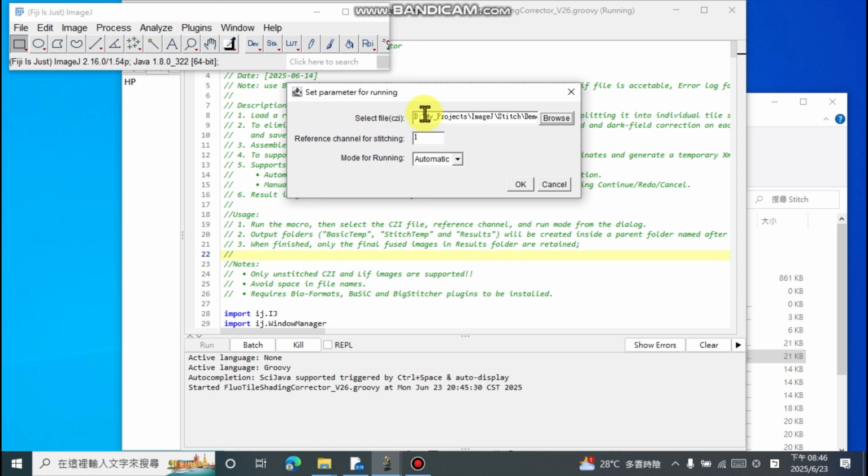The second parameter is the reference channel used during the stitching process. The reference channel affects the stitching quality. Shading Corrector offers two execution modes. The first is automatic mode. It will do all the work at once according to the reference channel you specify.